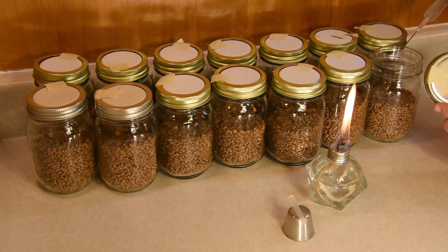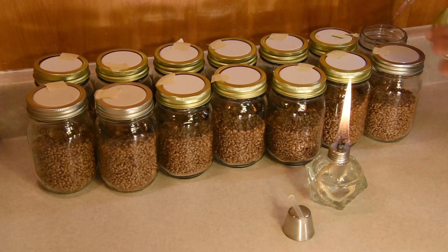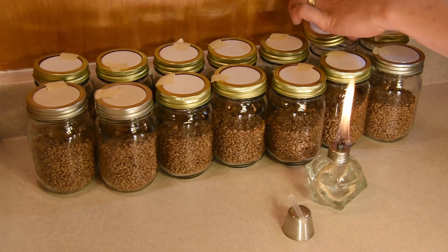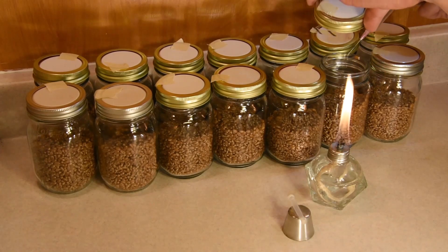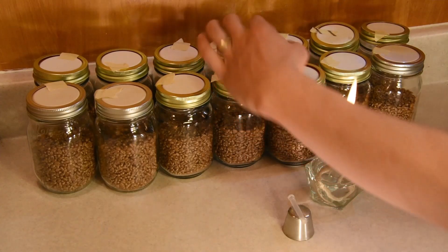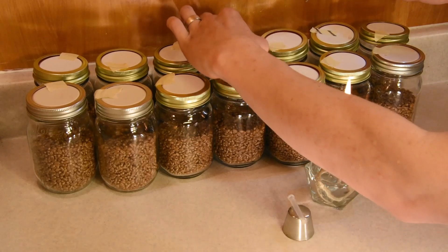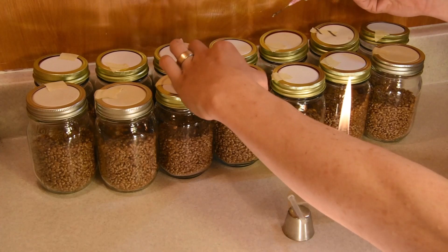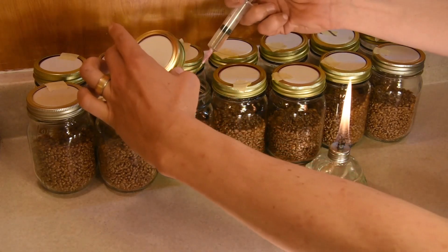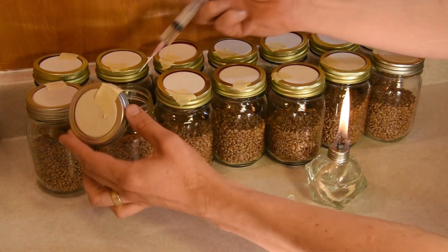Now I don't have to struggle with it — I'm just going to lift the lid and squirt a little bit in there. You can see it kind of exploded because of the heat. I'm going down the line, trying to keep my hands away from the opening by holding the back of the syringe, putting a few drops in each one. You really only need a little bit. The needle's already been shaken up so the mycelium is broken up and floating suspended. I'm mostly just trying to keep my hands away from the open mouth of the jar and make sure it's open for a very short period and closed quickly.